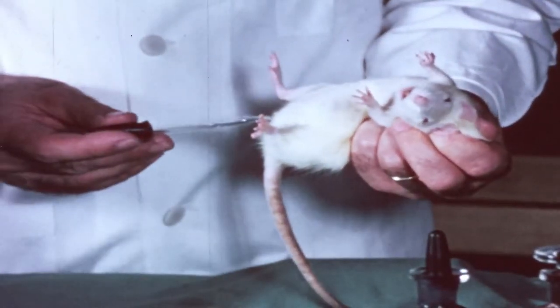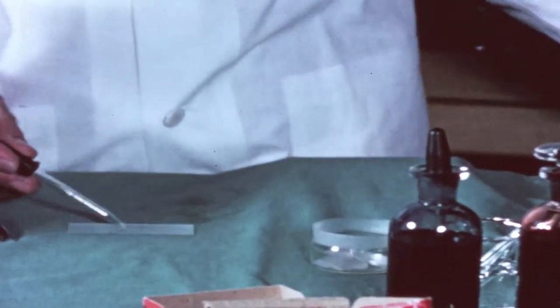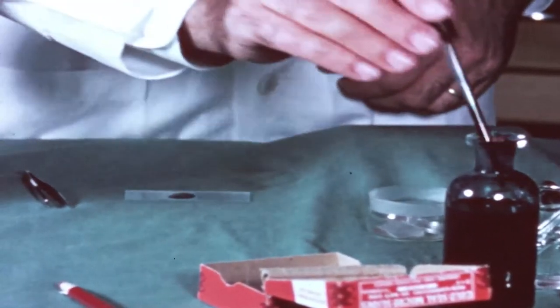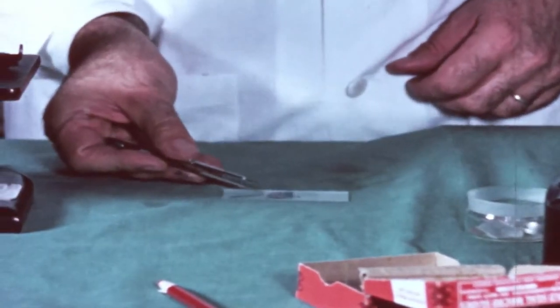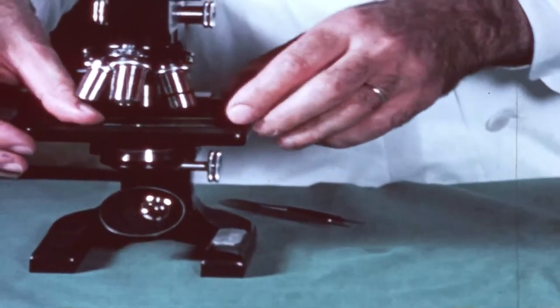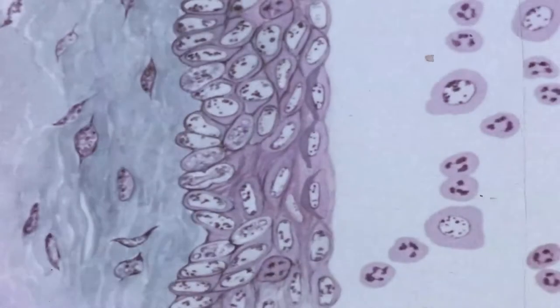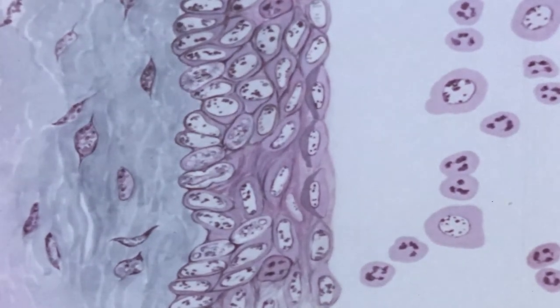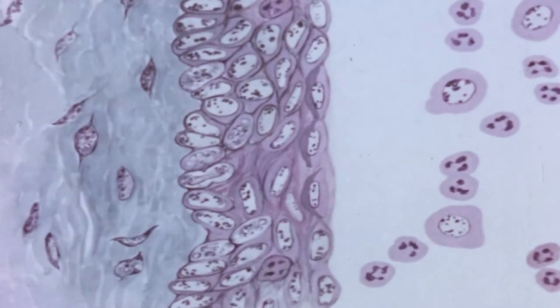Another method for timing the events in a reproductive cycle is by examining the vaginal smear. Let us now observe the alterations which occur in the vaginal mucosa during the cycle and which account for the changes in cell types observed in stained smear preparations. For orientation, let us examine a section through the wall of the vagina removed on the first day of the cycle.